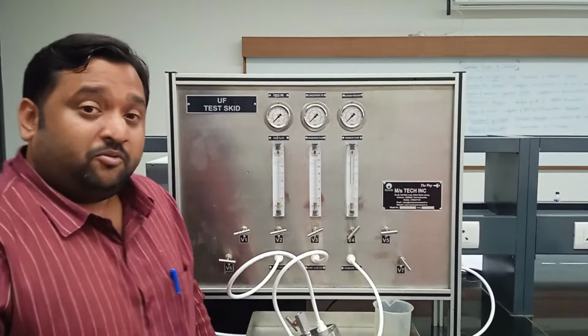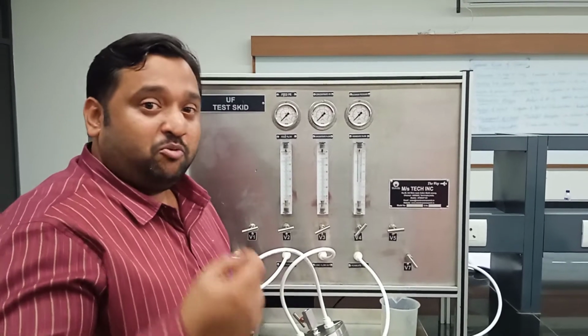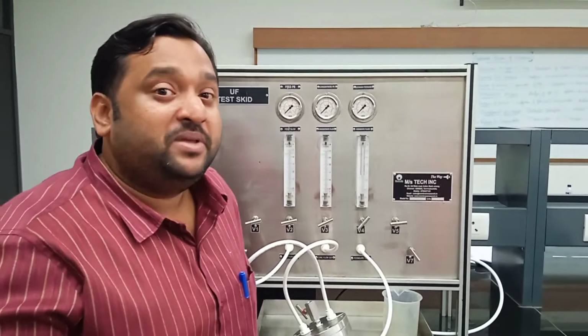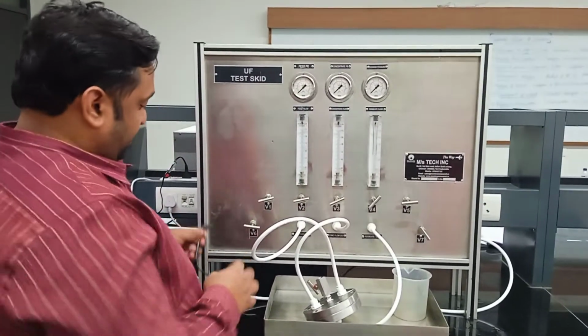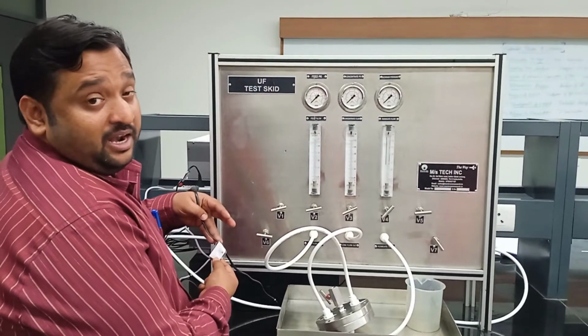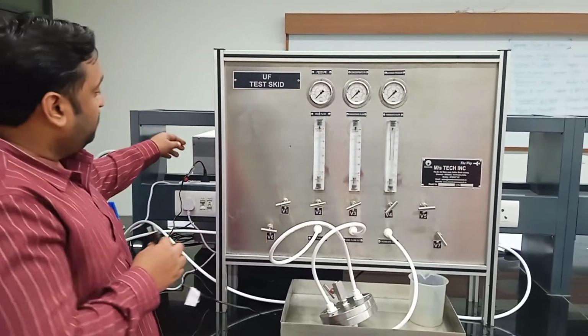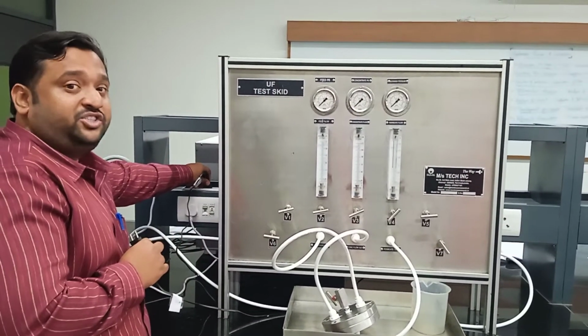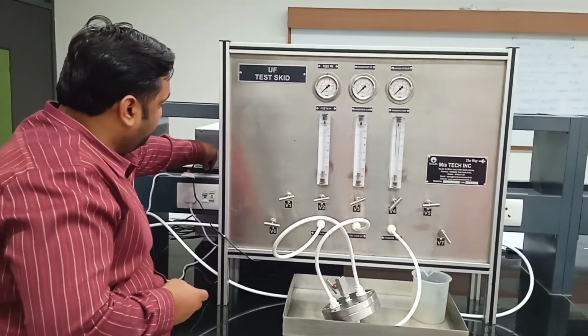One important thing is, before you do the backwashing mode, make sure the proper pump is connected to the electric supply. As you can see, the wire is tagged with B, related to the backwashing pump. So you have to unplug the filtration mode pump and plug in the backwashing mode pump.